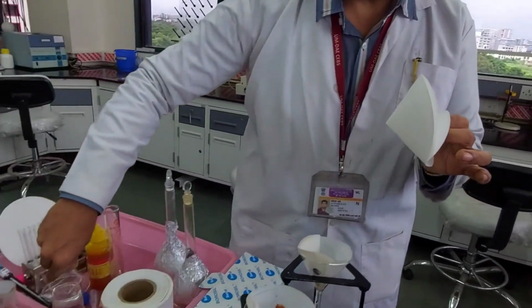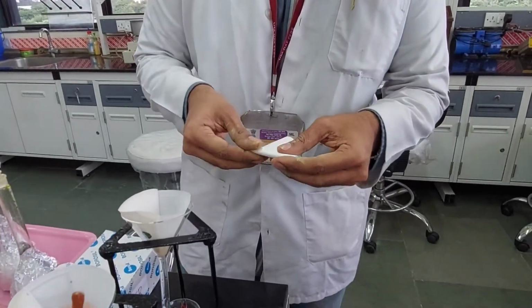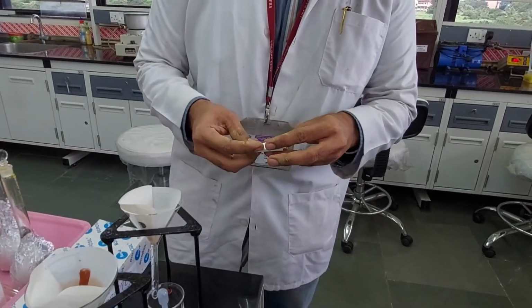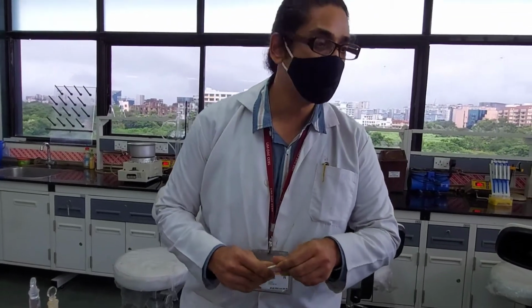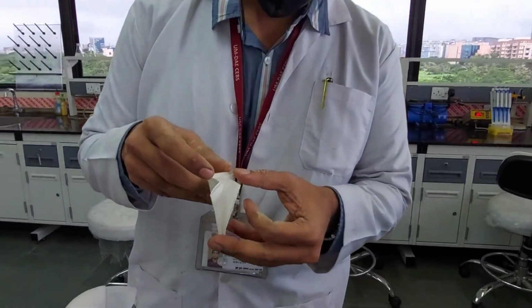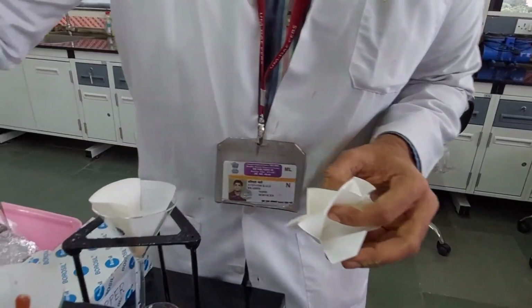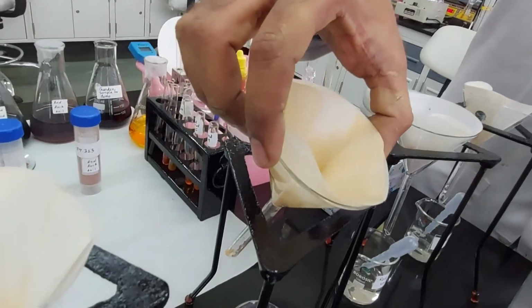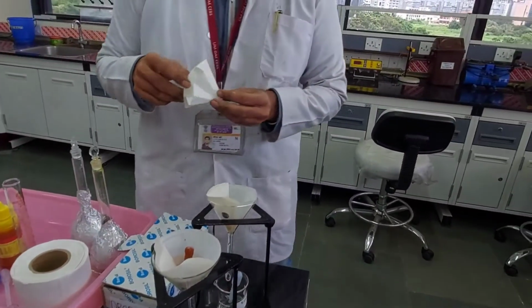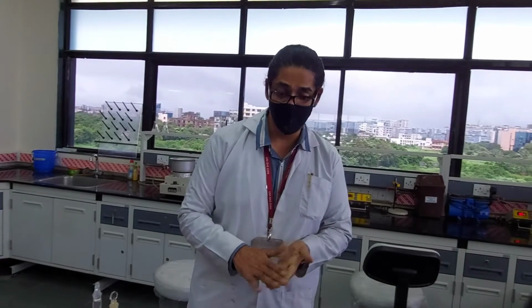Now to save your time, what I would recommend is that you make the same filter paper as a fluted paper. What do you do as a fluted paper? You make the Japanese fan out of it. You do it like this, and then you open it up again. You see this? Now this is the advantage. You get nice air pockets and this saves a lot of time. I'll say your filtration time will be reduced to half. It can be better.